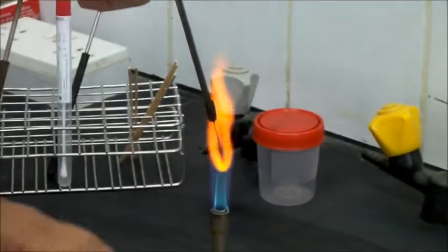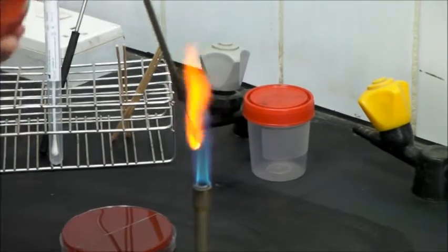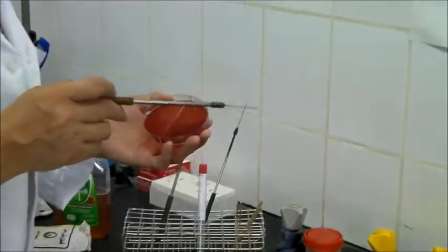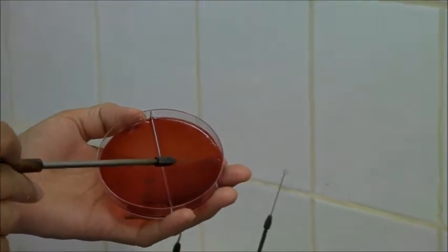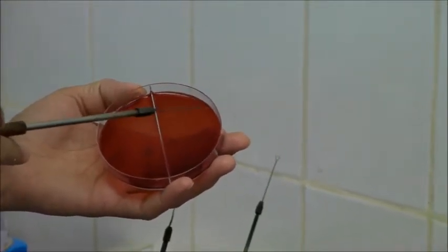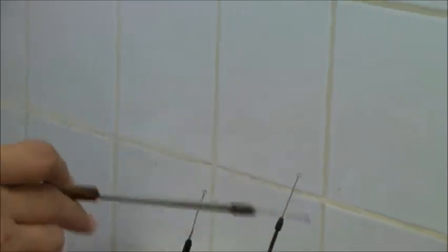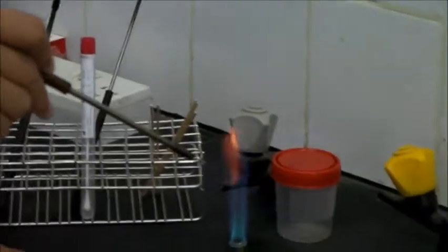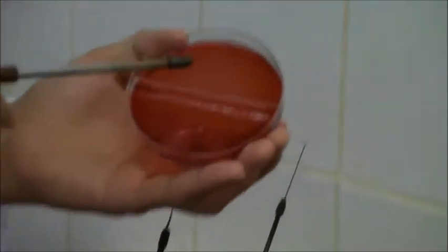Now we take the second plate, the MacConkey agar. We flame the loop and take some of the sample which we swabbed and make streaks. Then we rotate the plate. Again we flame the loop and take another sample from the second streak, make the third streak, and the fourth streak without flame.